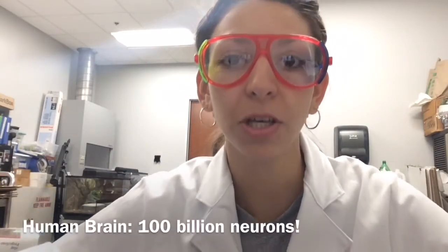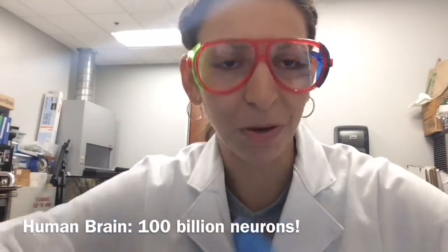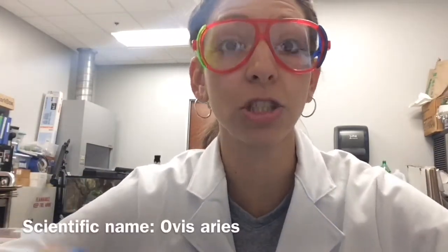And remember, every aspect of who we are, from our personalities to how we sleep, is going to be governed by the brain. And the brain is just part of our nervous system, and again, we'll explain more about the nervous system in other videos, but today we're just focusing on our mammalian brain structures and how we're going to do the dissection. So the human brain has about 100 billion neurons. That's so many. But we're not actually dissecting a real human brain. We're going to look at another mammalian brain, which is the sheep brain.